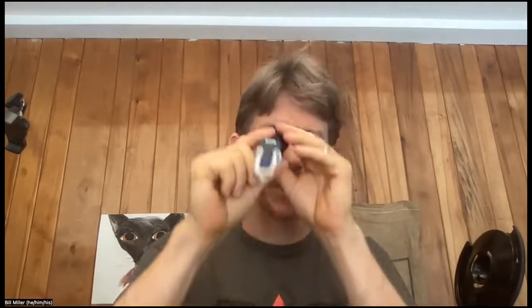Just let it fold down nicely. Takes a couple seconds for it to get to the bottom. Yes, I do have an air bubble down at the bottom. I have one at the top too in that picture, but I don't.